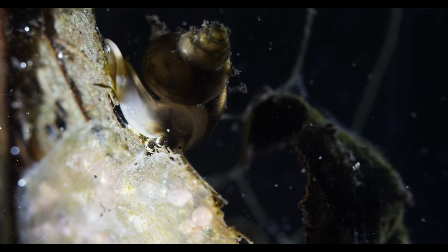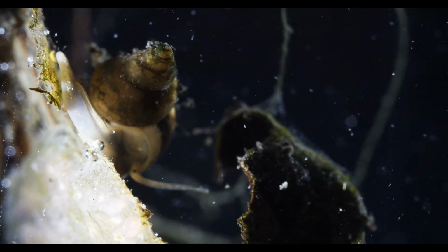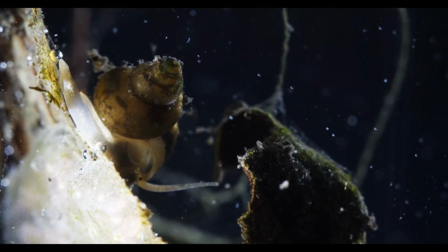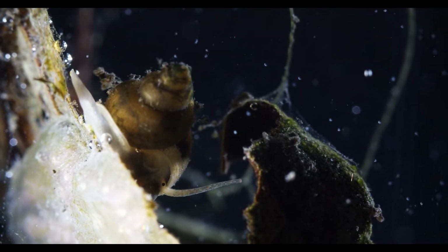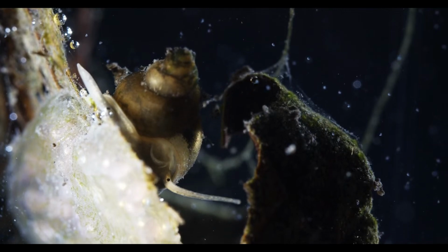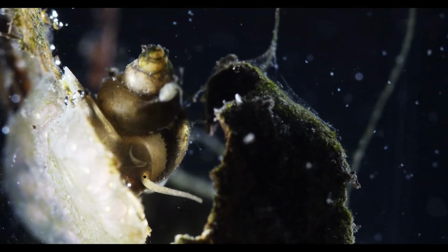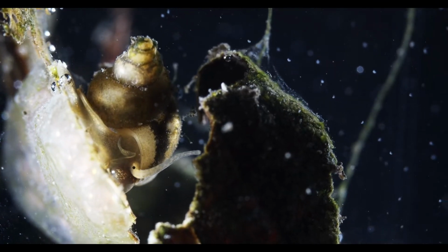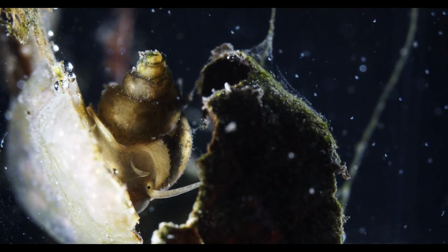So this snail, for example, I don't know what kind of snail it is. In my literature, the snails are all just pictured as empty shells, basically. Oh, I think it was pooping. Just pooped. And this shell, I don't know.